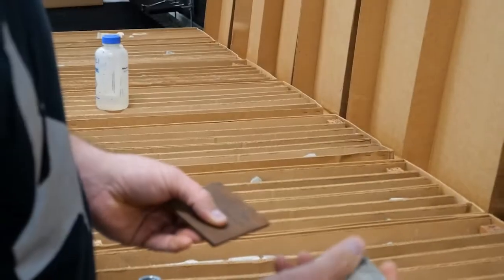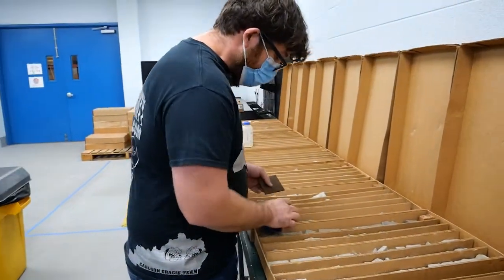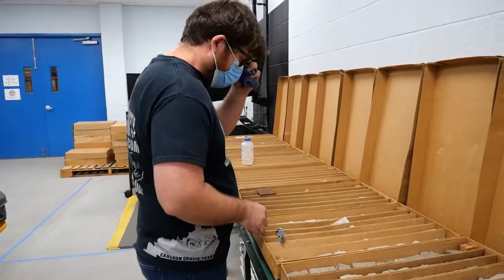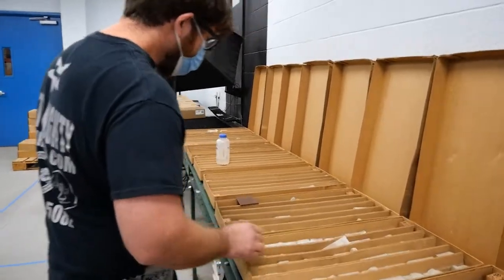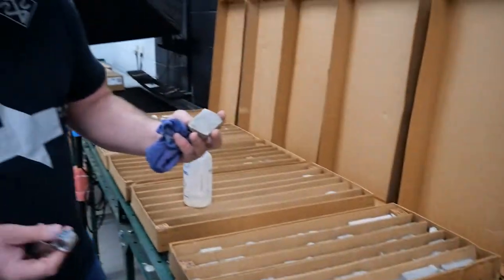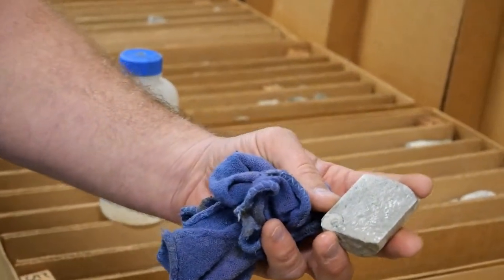Because it leaves the steel on the material, which is chert. The next thing I look for is key features in the core. Here I have a calcite-filled mineral vein. And down here I have a gastropod, which I use a hand lens to help me identify. A gastropod is an ancient snail.